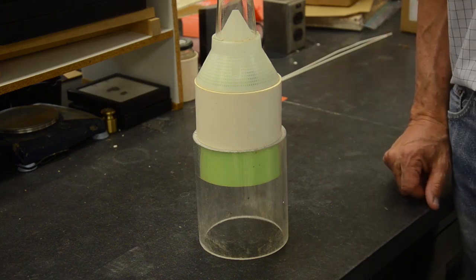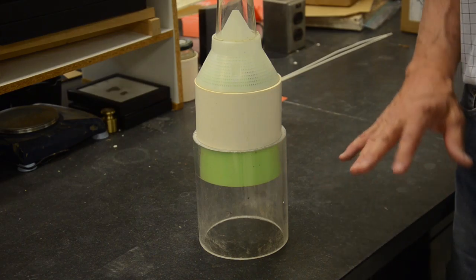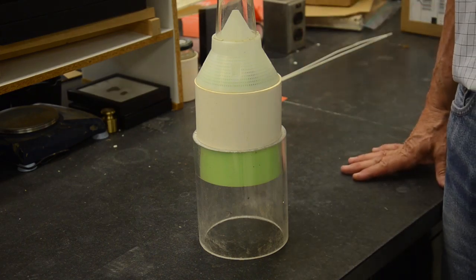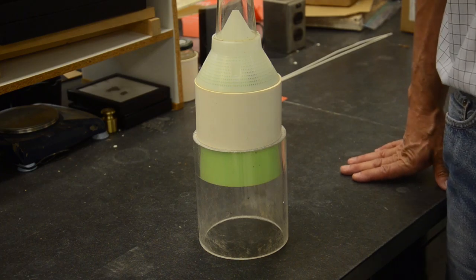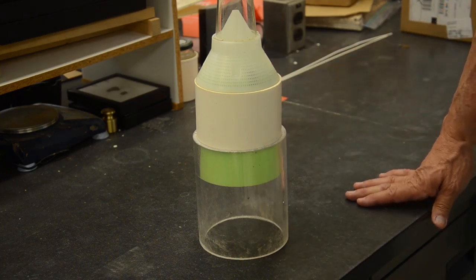You can replicate it many times, so we have a number of replicates in the different treatment areas just to see how the nematodes that may be present are affecting the insects that we put in there.